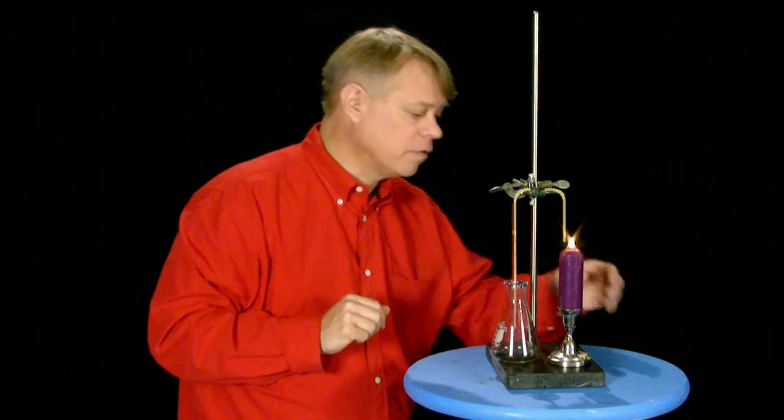We will examine this dark part first. And now I take this bent glass tube and introduce one end into the middle of the flame.